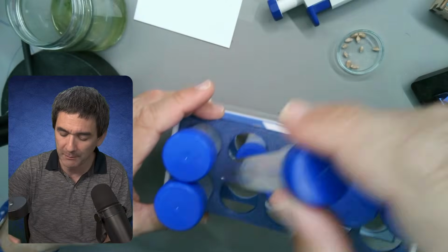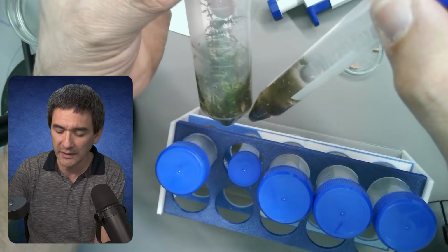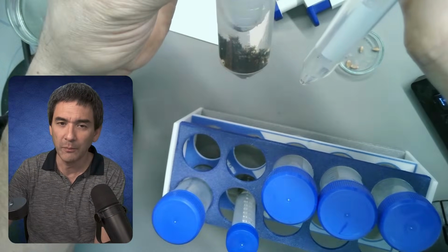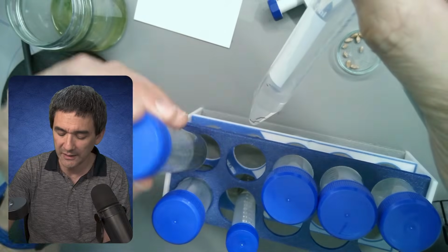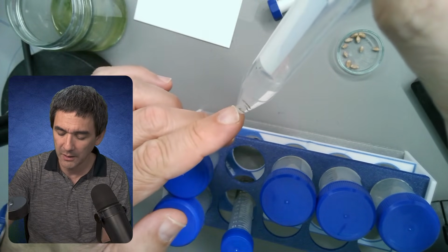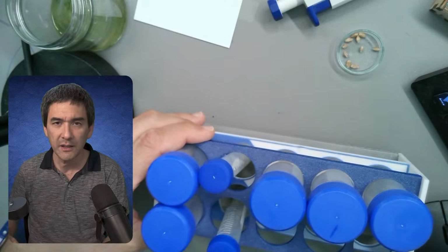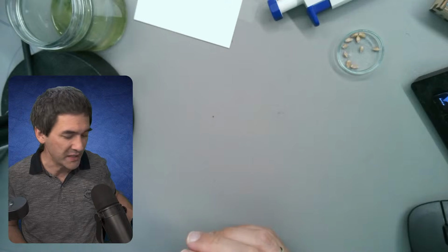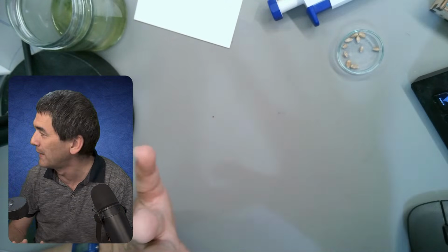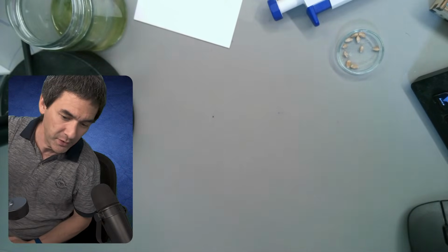And I've got over here 4 samples. That's the one sample that I collected, and this one over here is some moss that I collected from the same place. And over here, this is from this water fountain as well. In here, there are a couple of larvae, which I would like to have a look at. Okay, and we're just going to take it from there. Honestly, as always, I don't fully know what to expect. And I just realized that I'm super well prepared because I'm missing half of my equipment. So I need to get myself a couple of Petri dishes. You have to bear with me for 10 seconds.